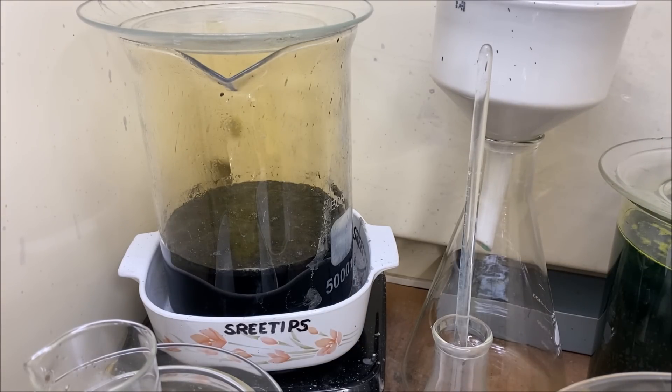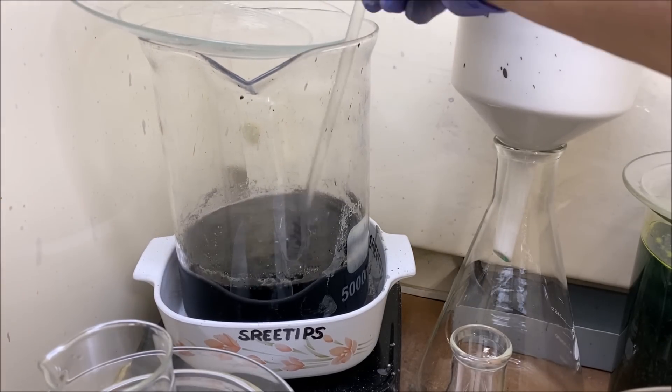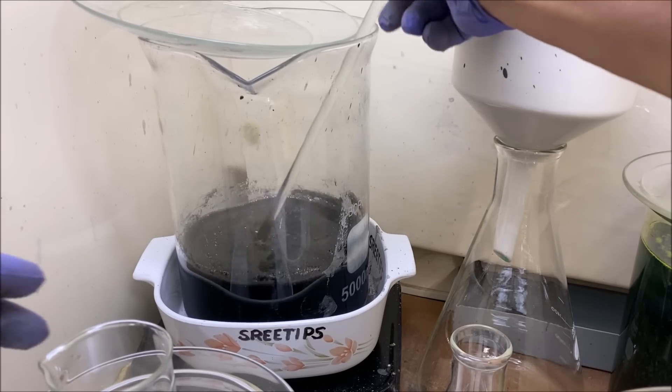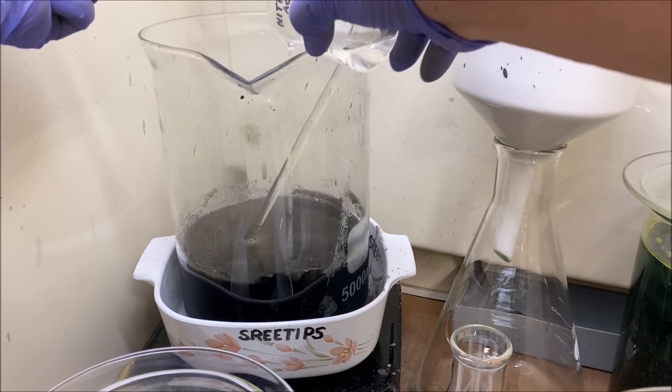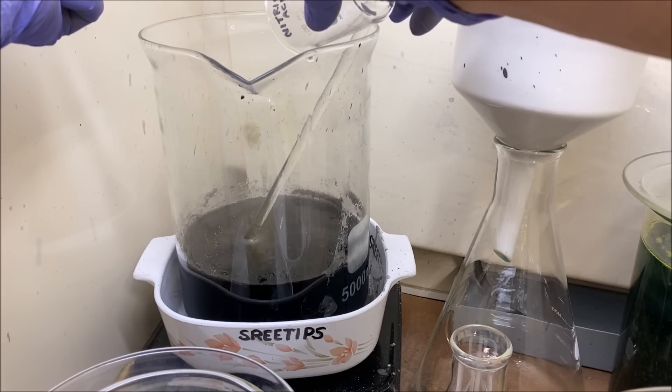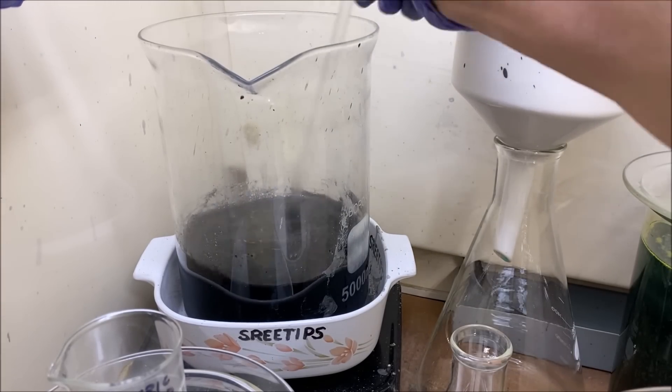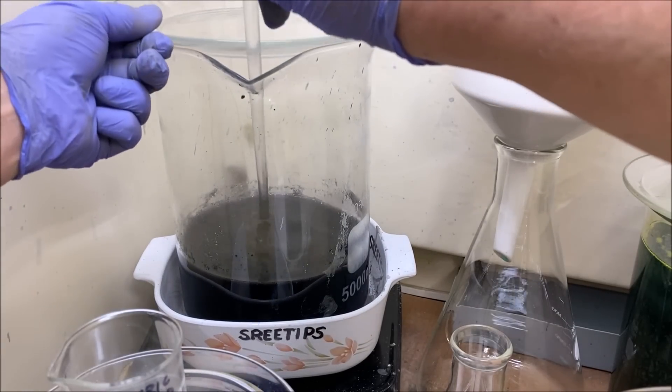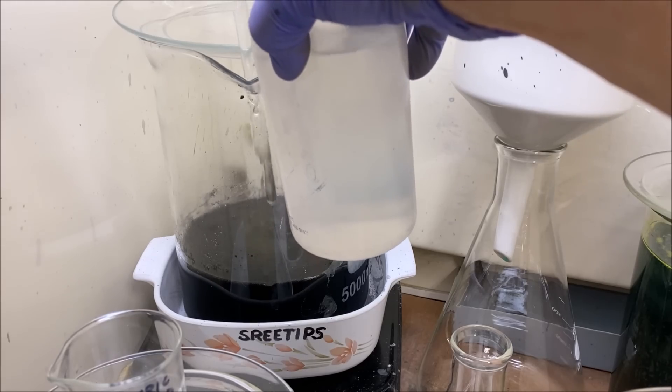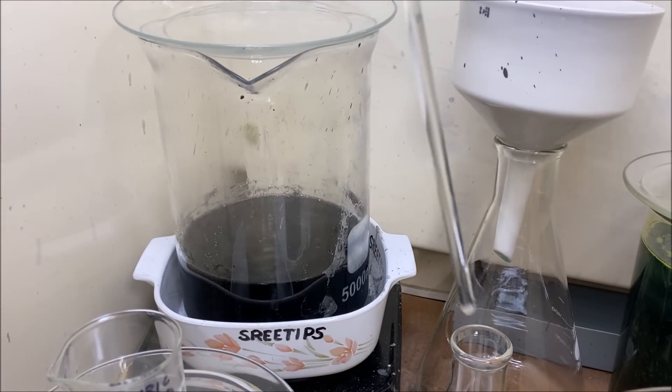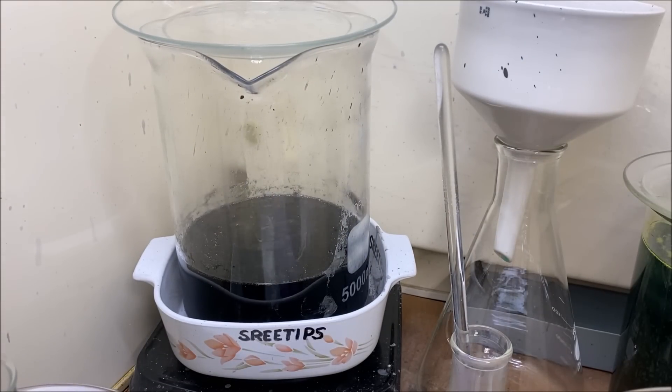This has been on the heat now several hours. It's hot, I don't see any more fumes forming. I'm going to add this last little bit of nitric in, and I don't see a whole bunch of fume production from that. So I'm going to conclude here that all the material soluble in nitric has been dissolved. I'm going to turn the heat off and let this cool down.